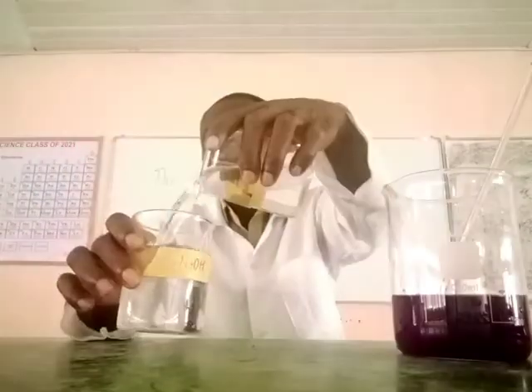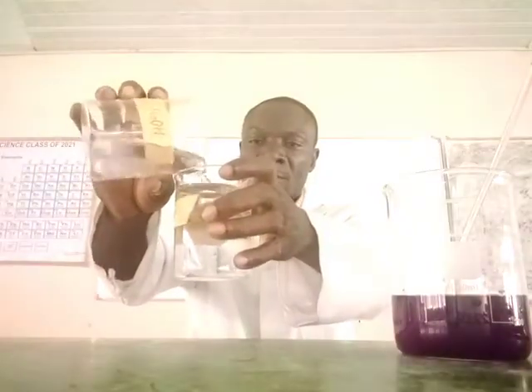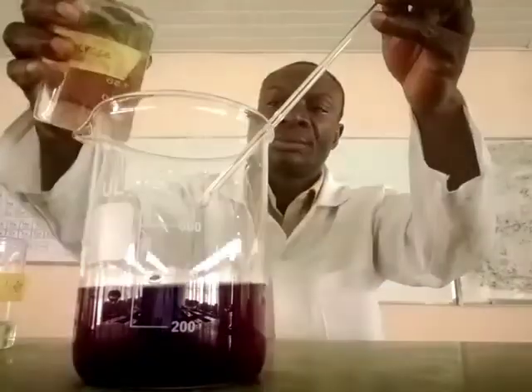Now, I'll turn it to the potassium permanganate solution. Watch.